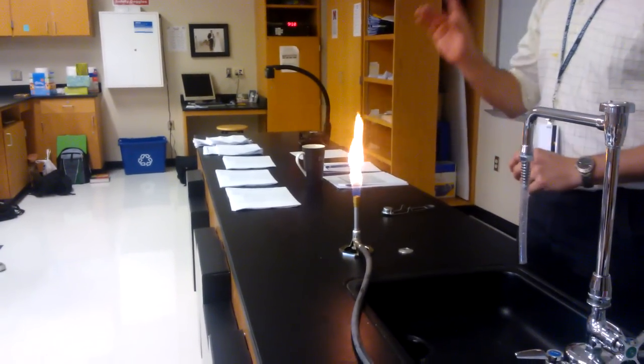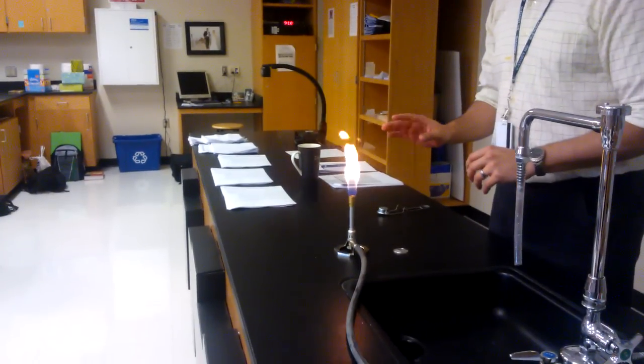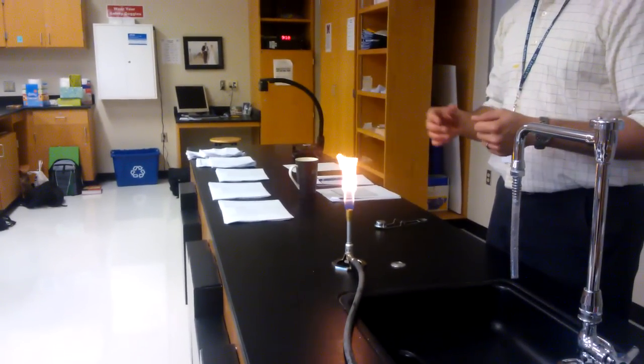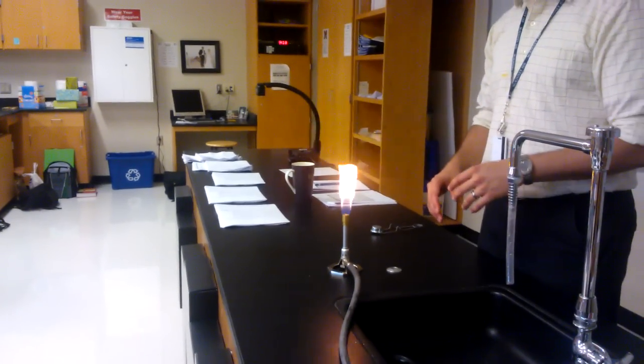I, however, don't want to work with a yellow flame in chemistry. I want a blue flame. A blue flame is a hot flame. It's also called a clean flame. So how am I going to get a blue flame?